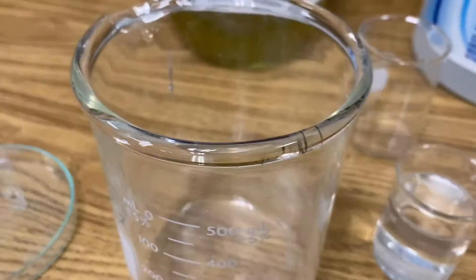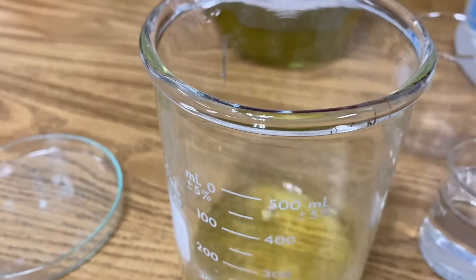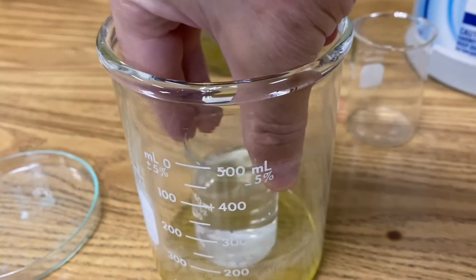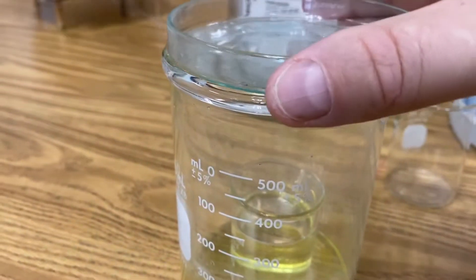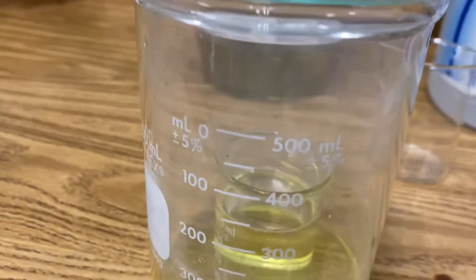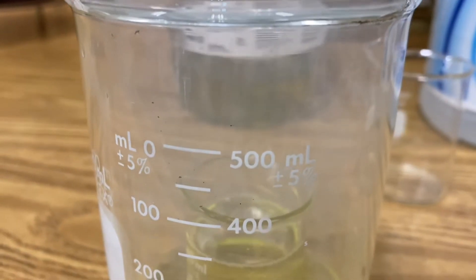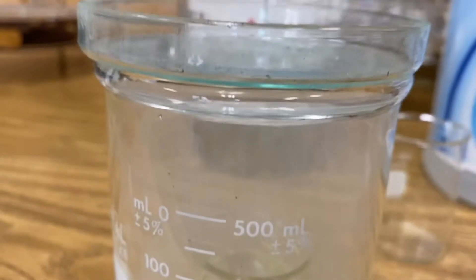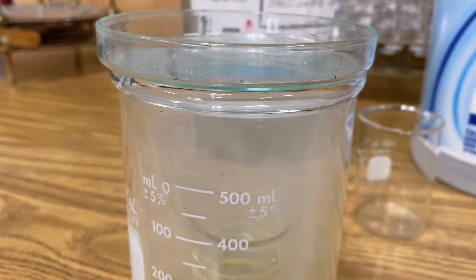Another way you can observe ammonium chloride is simply take your hydrochloric acid, pour it into a larger beaker, and then lower your smaller beaker of ammonia into the larger beaker, and then cover it with a petri dish. You'll start to see that gas form inside the beaker. And as more and more gas forms — this is an exothermic reaction — you'll start to see deposition on the bottom of your watch glass as ammonium chloride crystals start to form.